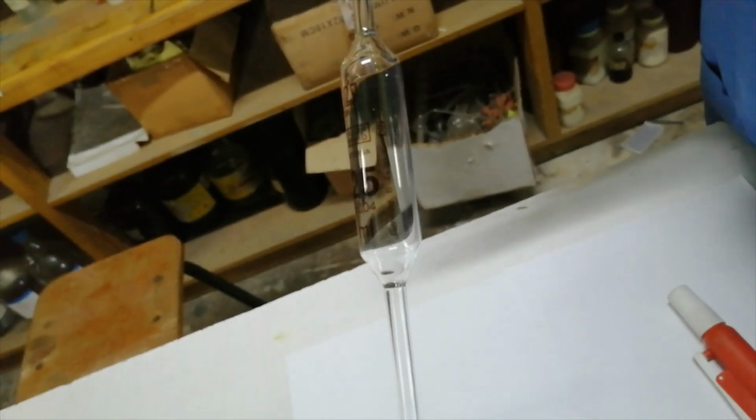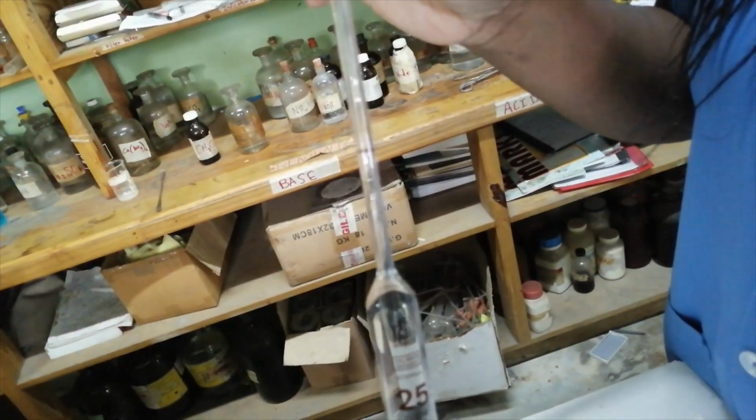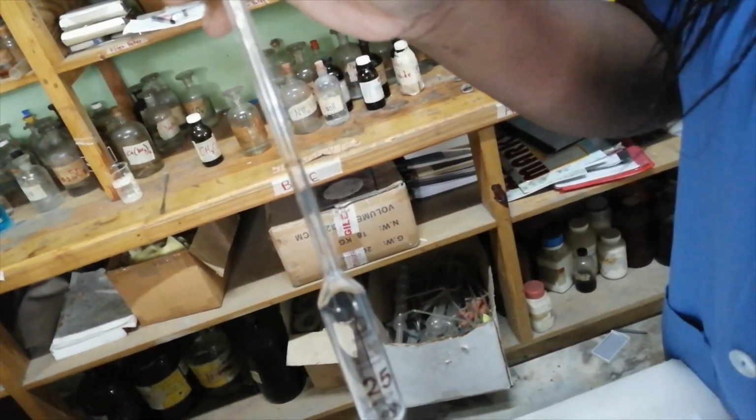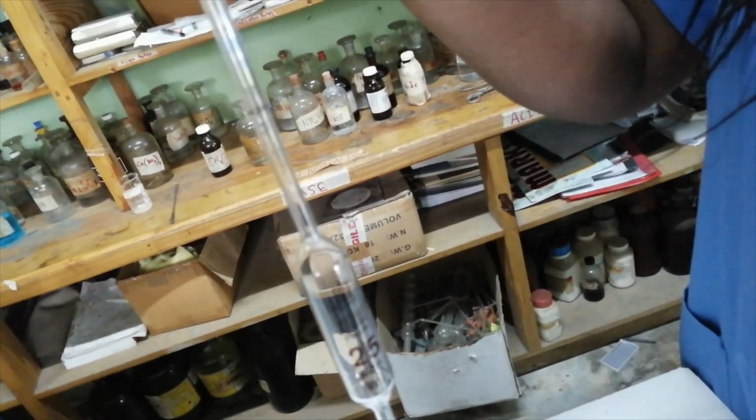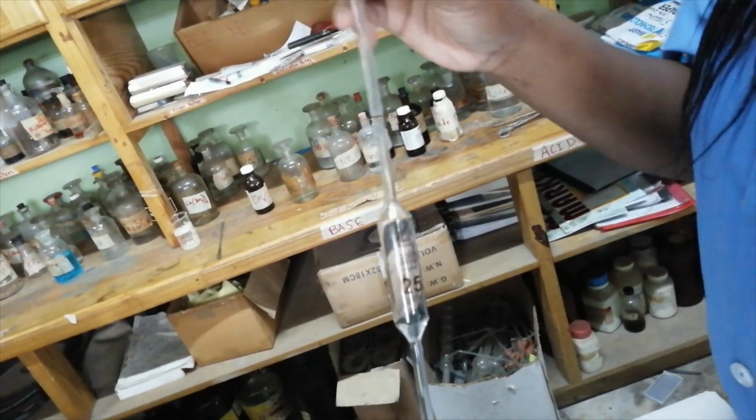To the side, you will see that the temperature of the liquid that goes in this pipette should not exceed, say, 20 degrees Celsius. Ideally, it should not exceed that. This mark right here is, of course, the meniscus line. So when you're transferring your liquid, the meniscus should sit on that line right there. That is the only way you'll know that you're transferring 25 cm cubes of liquid.